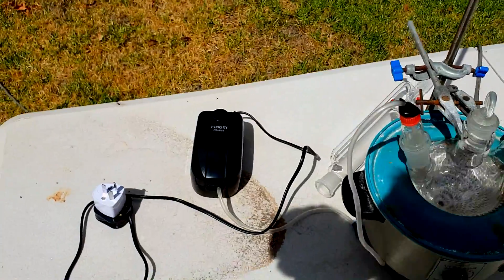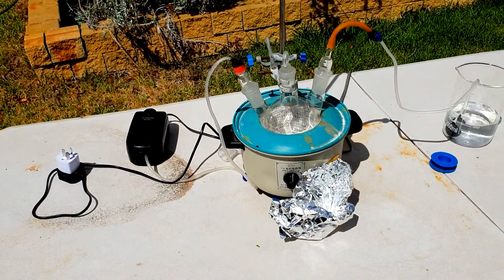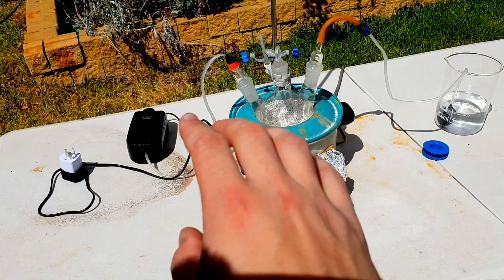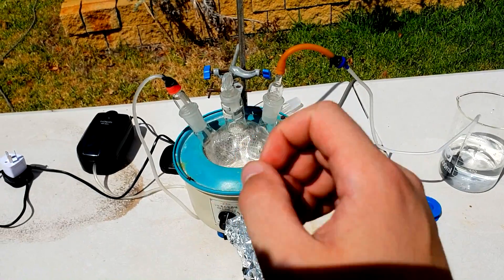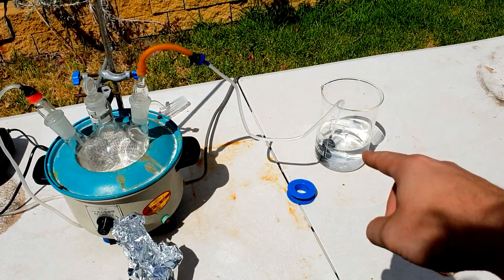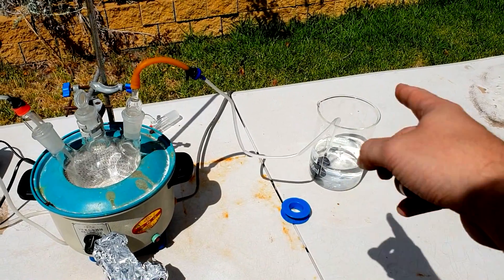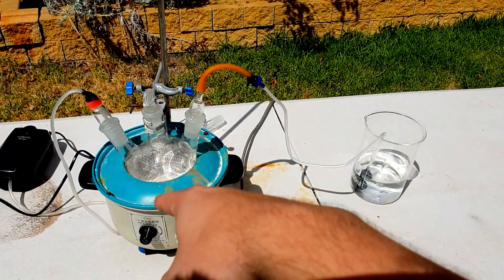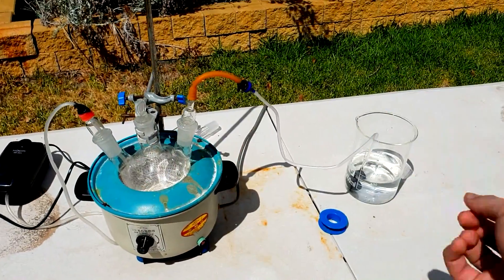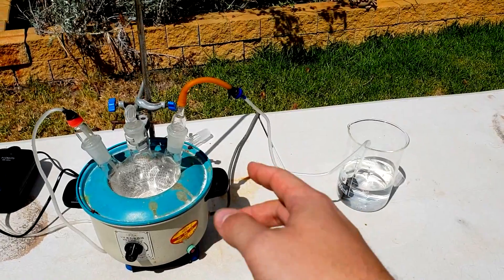The aquarium pump — this has actually stopped the sunlight getting on it, because it's like 35 degrees and very sunny, and the black plastic was starting to heat up quite a lot. So the problem with ammonia is, because it's so soluble in water, instead of the gas flowing nicely through the tubes, the water likes dissolving it so much that the water tends to go back through the tubing system. So even though you're making heaps of gas, nothing comes out the other end — the water actually goes back the other way, and you think this is breaking physics.